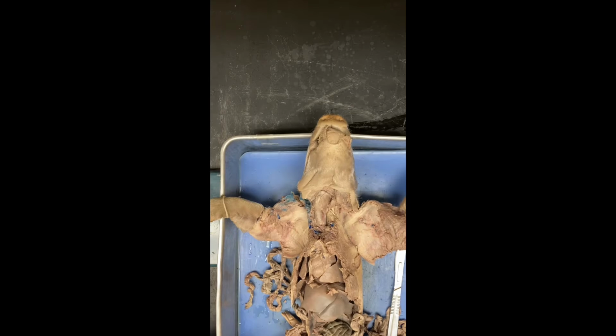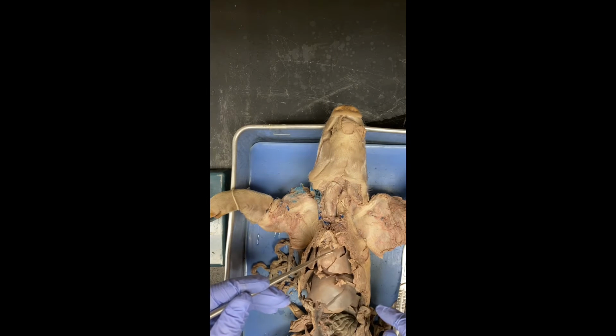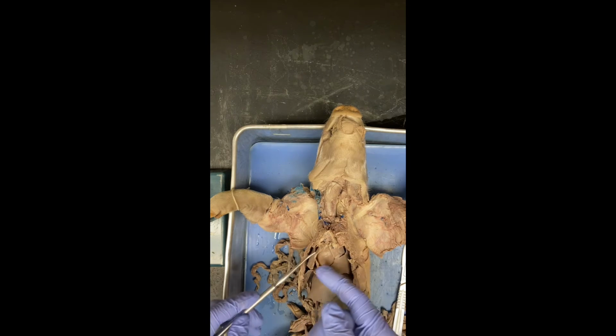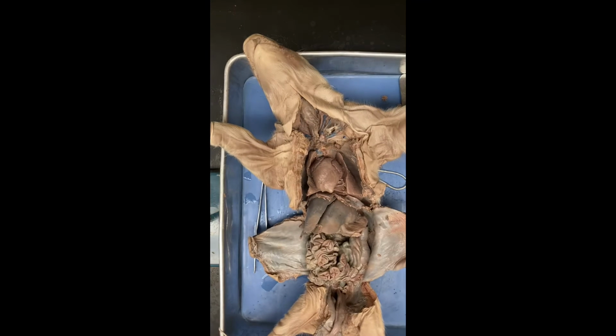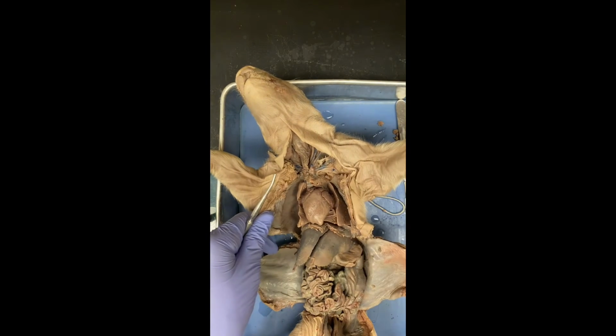So next I'm going to show, on this animal, the pericardium, which is a thin covering that covers the heart. So yeah, this right here is the pericardium. Now I'm going to move this animal out of the way for another one, which has its veins more exposed. And then I'm going to zoom in.